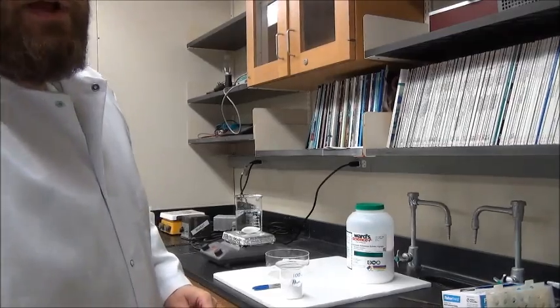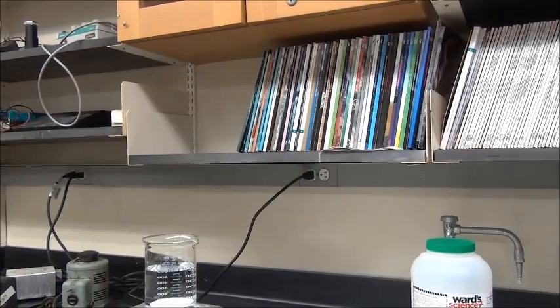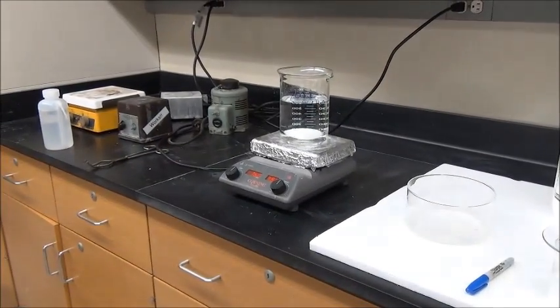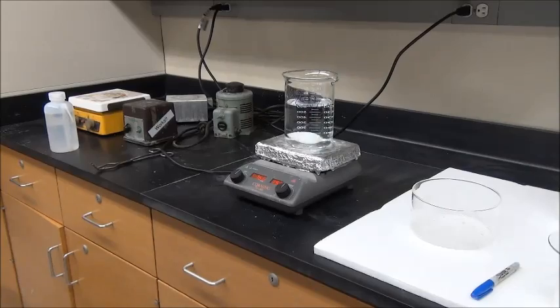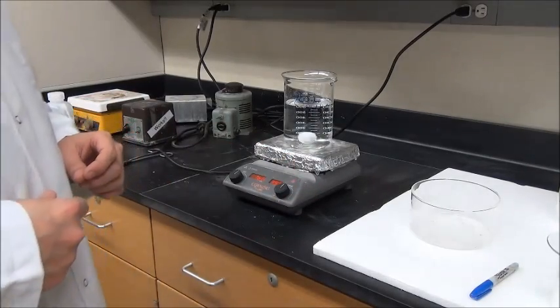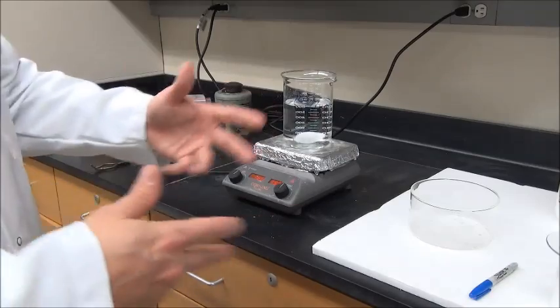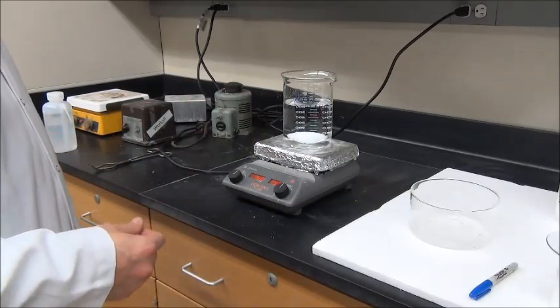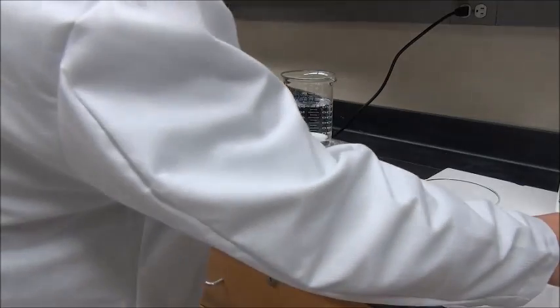It's important to note that I am using deionized water for this part of the experiment. You don't want to just use tap water because tap water contains lots of minerals and things.